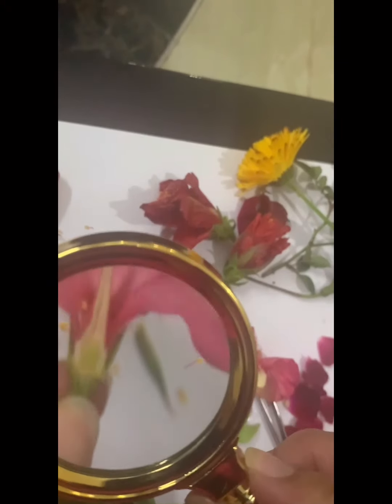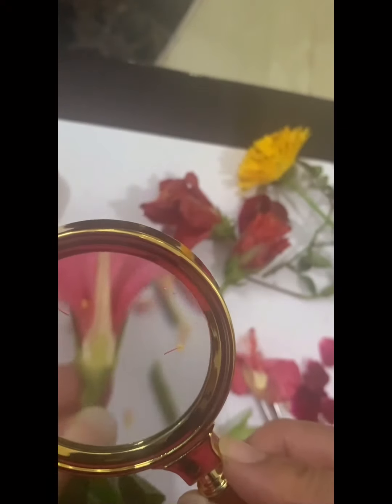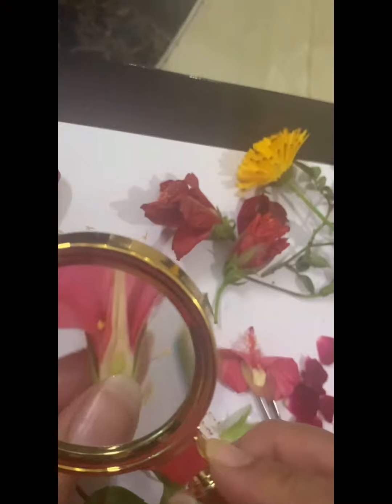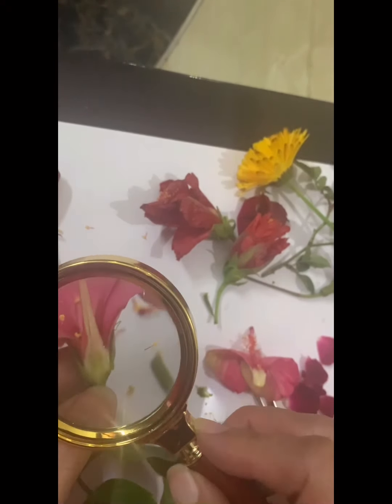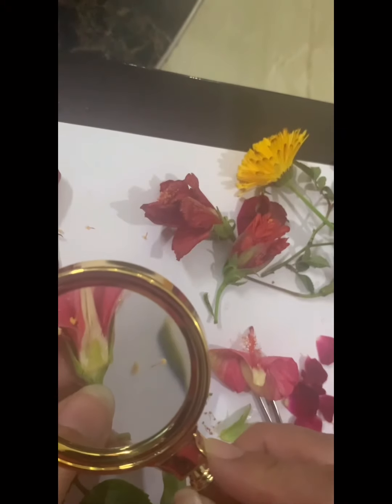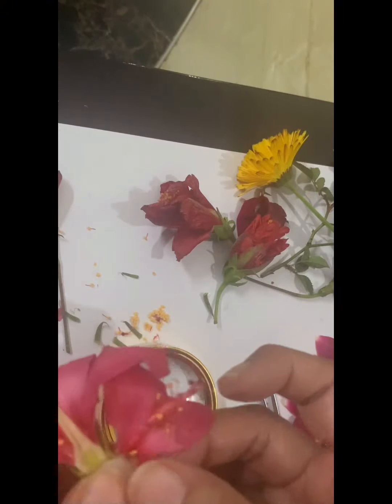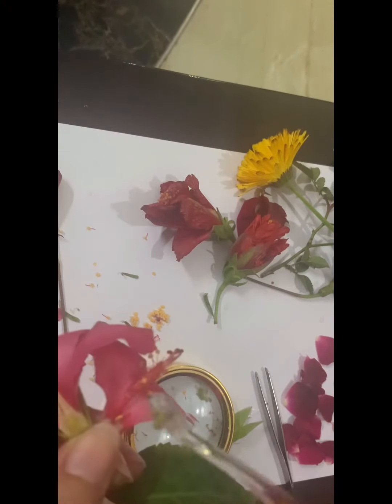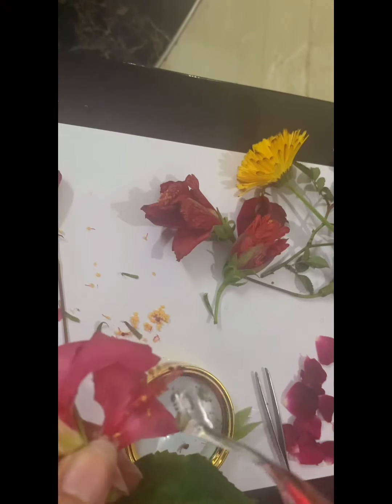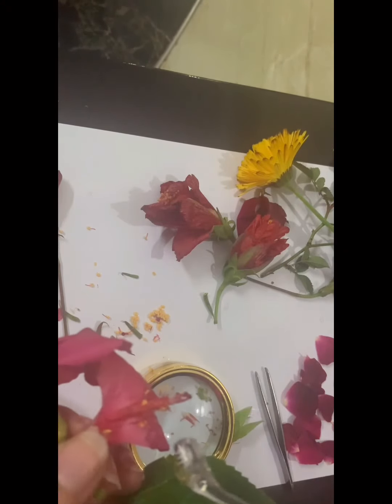The dark green portion that you see in the center contains the ovules. Then also we know that the hibiscus has the female reproductive organ, which is known as the pistil or the carpel. It has these stamens also, the yellow things. So it's a bisexual flower.